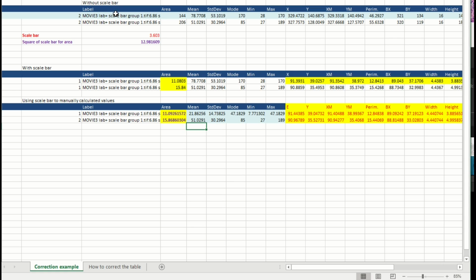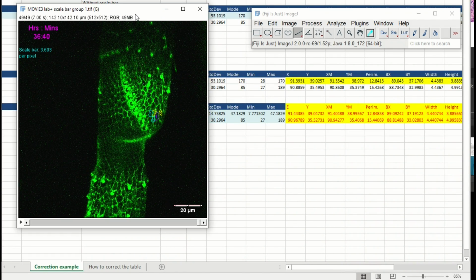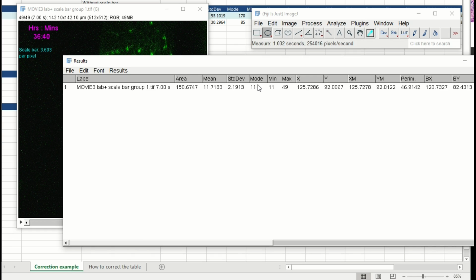Just to remind you, here we have all our values that we got when we measure anything. If you remember, when you press, for example, M, you have all these different values. Not all of them are affected by the scale bar. The area is going to be affected by the scale bar, but the mean intensity, the standard deviation and the mode measure the brightness of the tissue. So these are not modified.